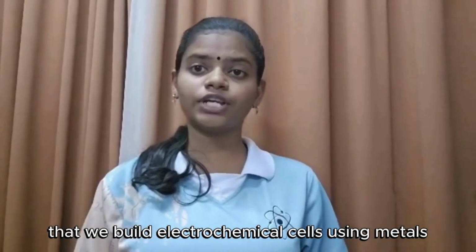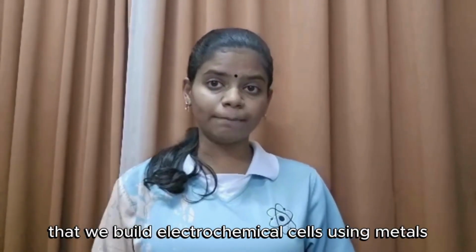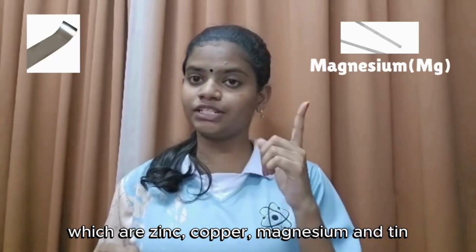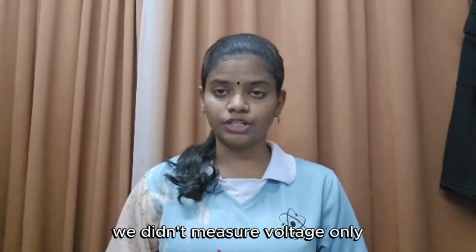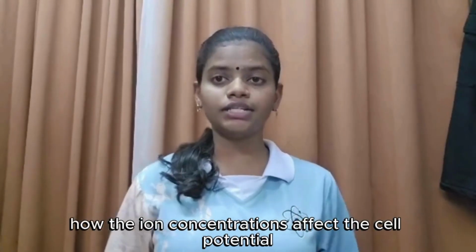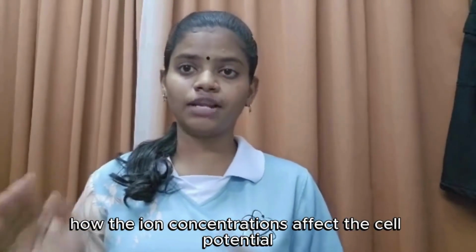Hi everyone, I'm Santia here, and I'm going to dive into something electric, quite literally, about electrochemistry, that we build electrochemical cells using metals, which are zinc, copper, magnesium, and tin. We didn't measure voltage only, but we have tested and measured how the ion concentrations affect the cell potential.